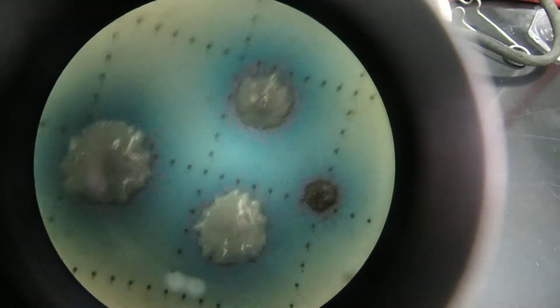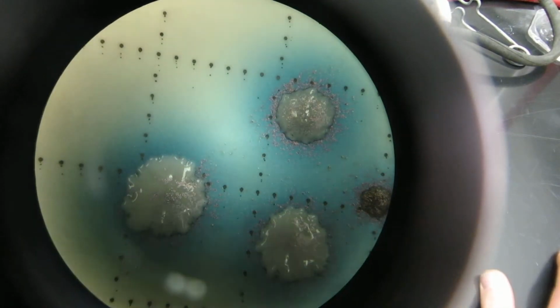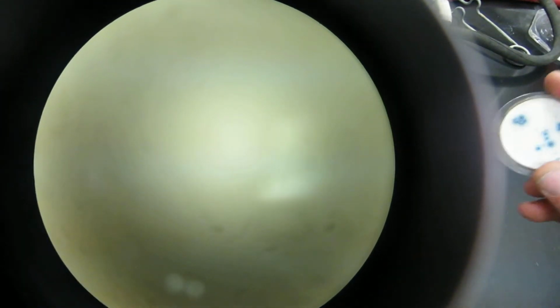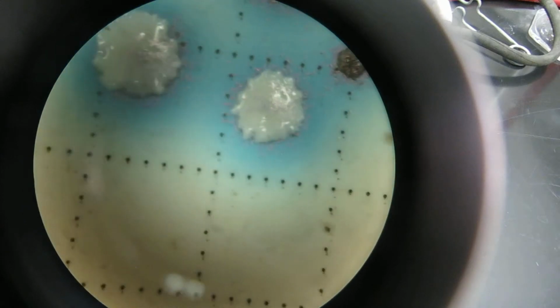And here's the mEI plate. This is another one. mEI is incubated at 41 degrees C, while the mTEC that I had there was at 44.5. So the mEI again is at 41 degrees C and the mTEC is 44.5. mEI is for Enterococcus. If you look at it on the side here, it just looks like blue colonies, but when you see it in the microscope here, you can see that they're actually white colonies with blue halos that you're looking for.